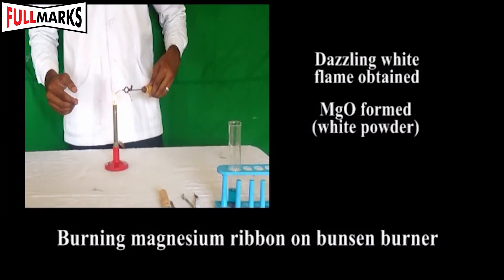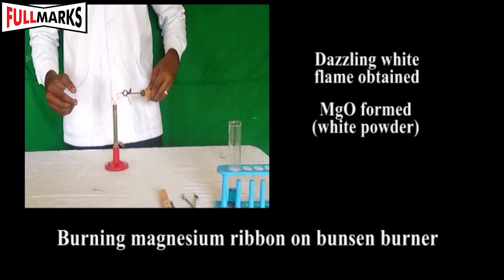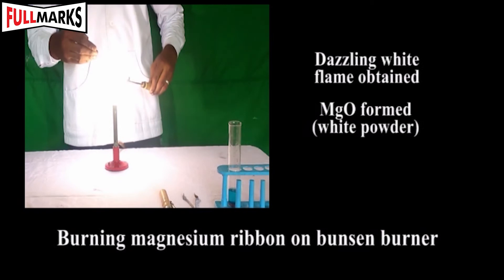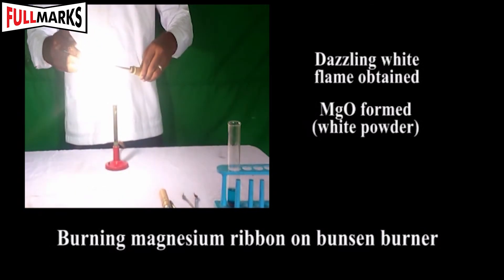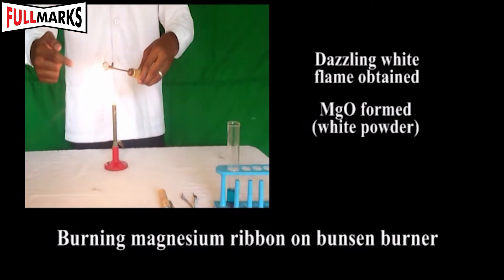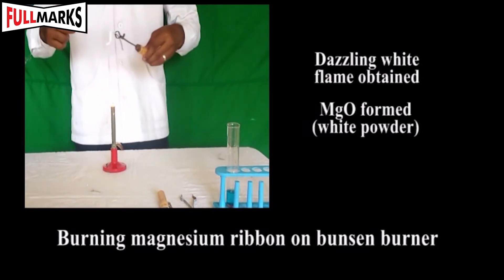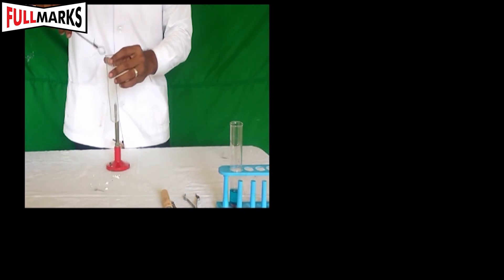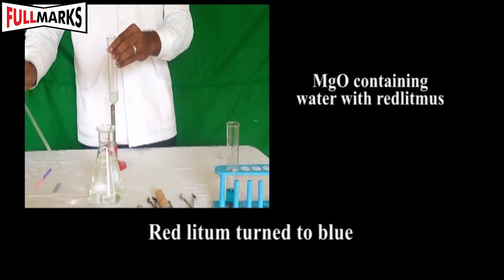Procedure 2: Hold a small piece of magnesium ribbon and burn it on a Bunsen burner. It burns with a dazzling white flame and forms a white powdery mass of magnesium oxide. Add magnesium oxide to a test tube containing water and test it with litmus paper — red litmus turns blue.